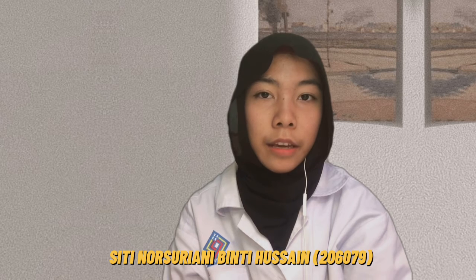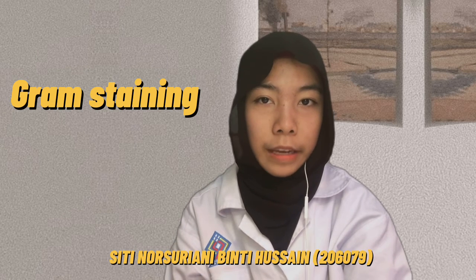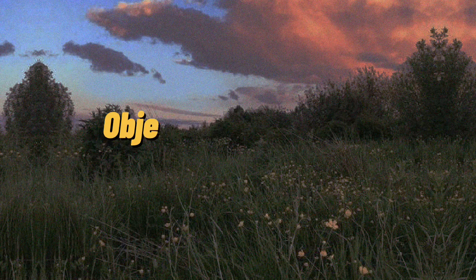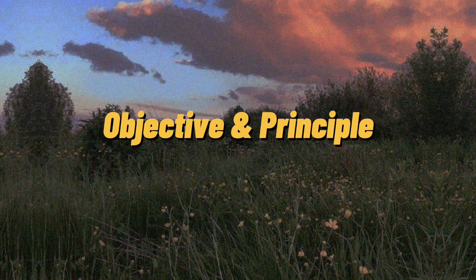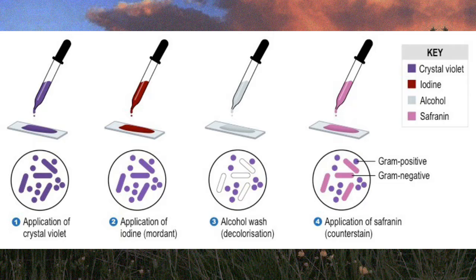206079. Today, I will show you a step-by-step technique of gram staining. The main objective of gram stain is to differentiate bacteria into gram-positive or gram-negative bacteria, which helps in the classification and differentiation of microorganisms. Gram stain is a differential staining that requires the use of at least 4 chemical reagents, which are primary stain, mordant, decolorizer, and a counterstain.